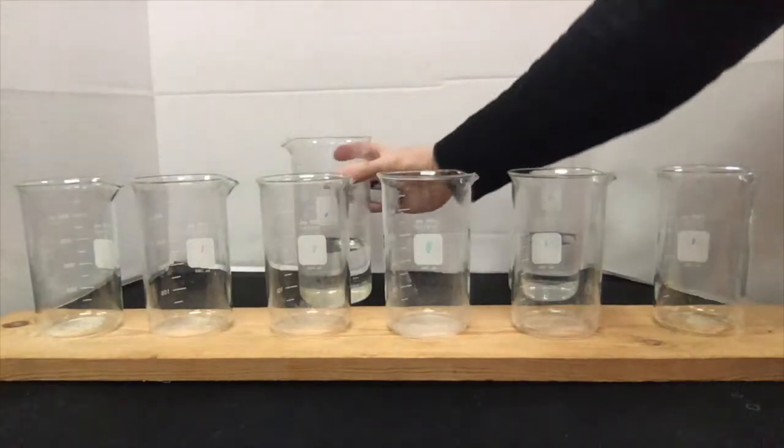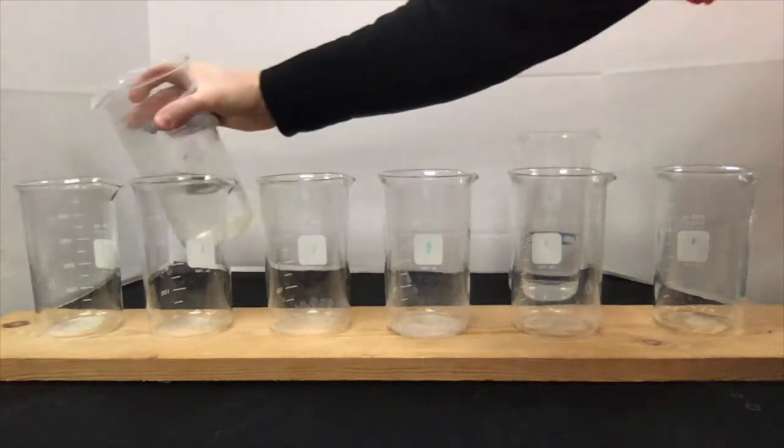Here's a demonstration to get you thinking. I like demonstrations. Here, a clear liquid is going to be poured into six beakers.